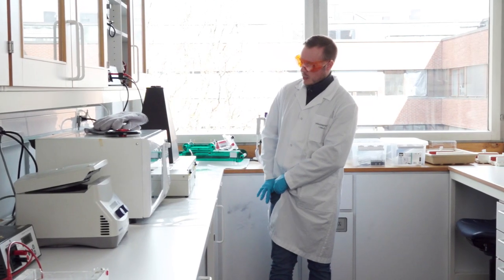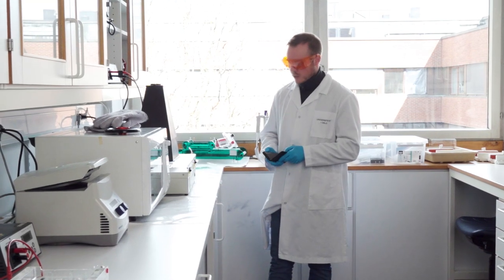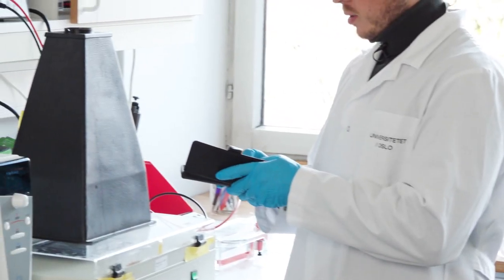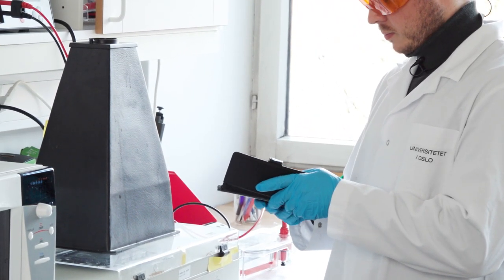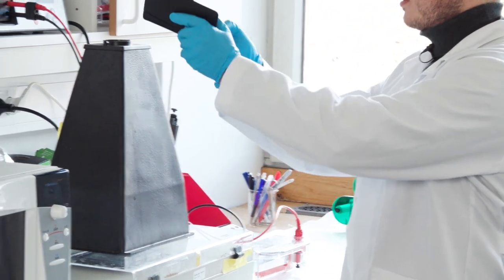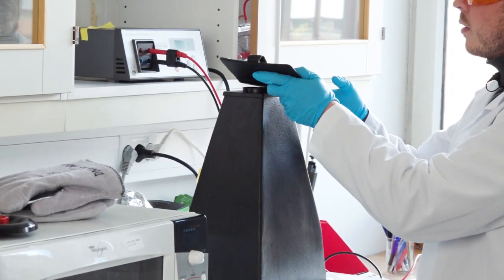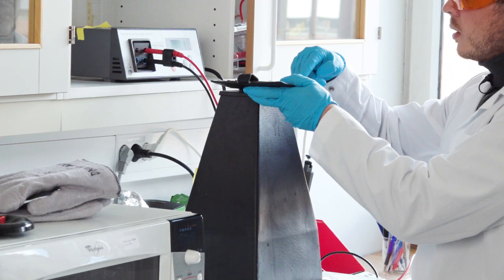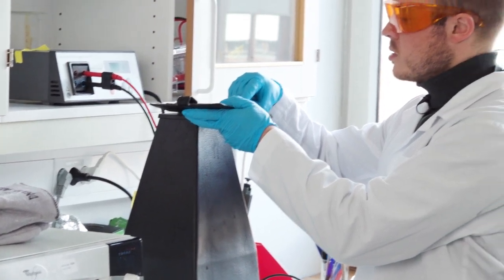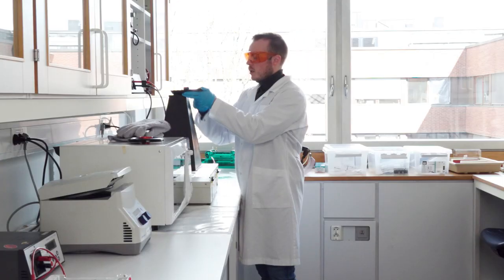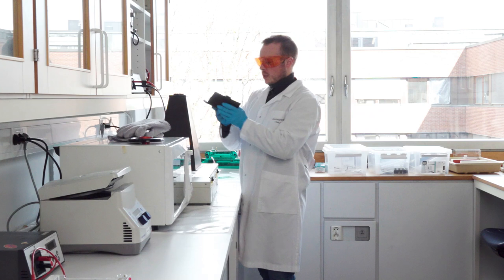But I highly recommend instead just taking a picture with your phone. And you take it inside here. And you just zoom in. And you take a picture or pictures of the gel. And then you can take them back to your computer and analyze that.